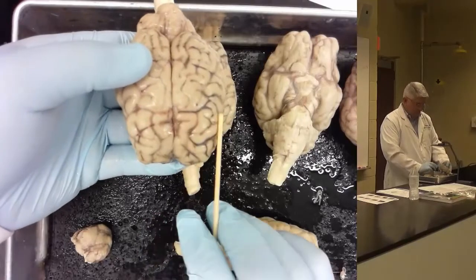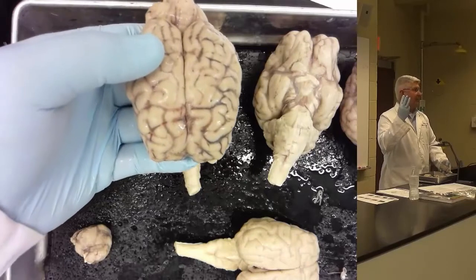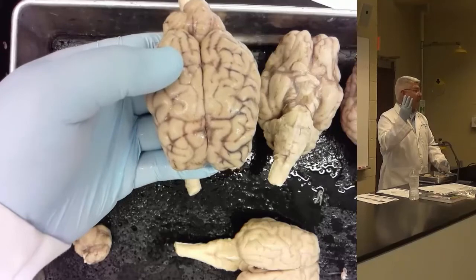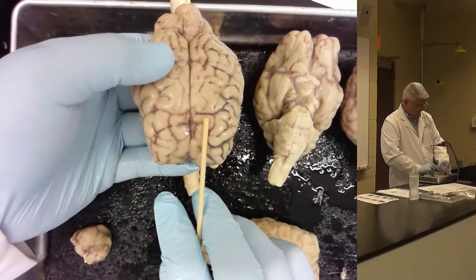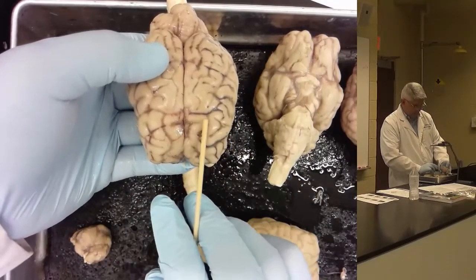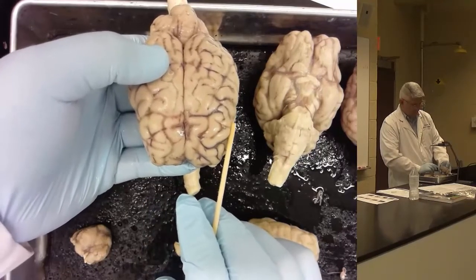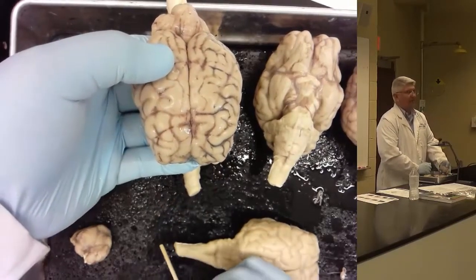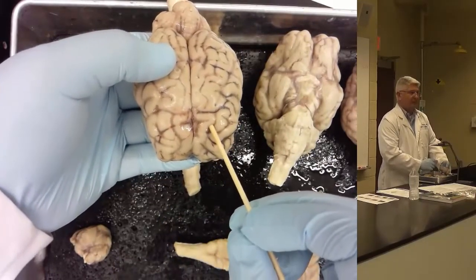Within the frontal lobe, there are 3 gyri. Each of those on each side is 1/3 of the frontal lobe. 1, 2, 3. Lots of thirds here. So here we have one gyrus, here we have the next gyrus, the middle gyrus. So we have superior, that's most medial, then middle, then inferior over here. Separating the superior and middle frontal gyri is the superior frontal sulcus.